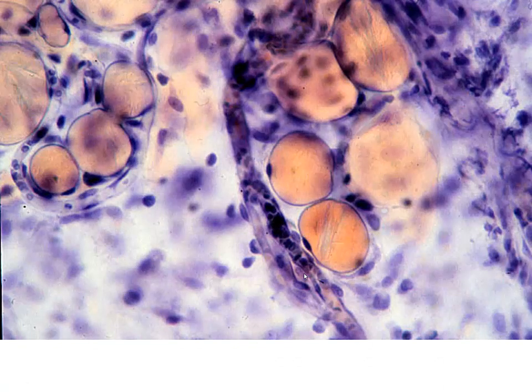This is a nice close-up view of our adipocytes. So we have our triglyceride material inside, a very thin rim of cytoplasm, the nucleus very peripheral and oval shaped and flattened. So this is our typical white fat or unilocular adipose tissue.